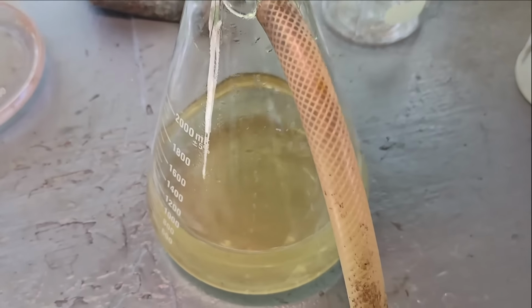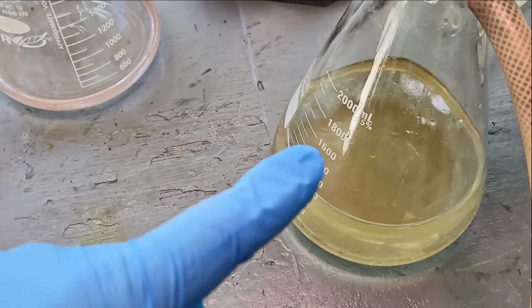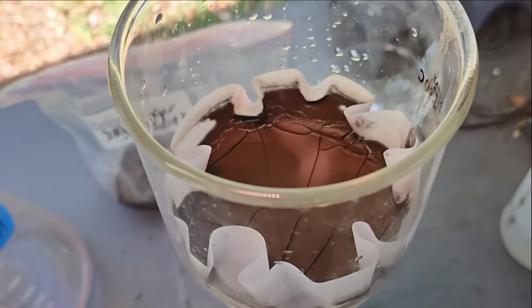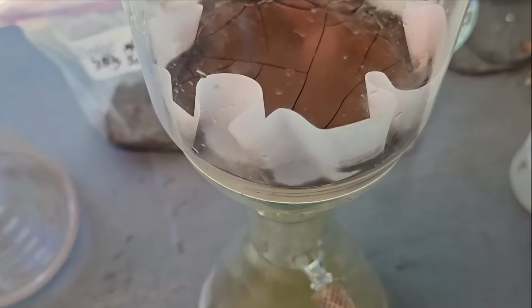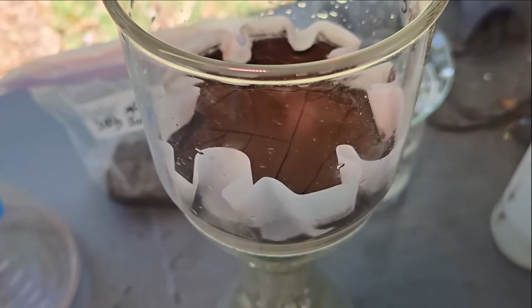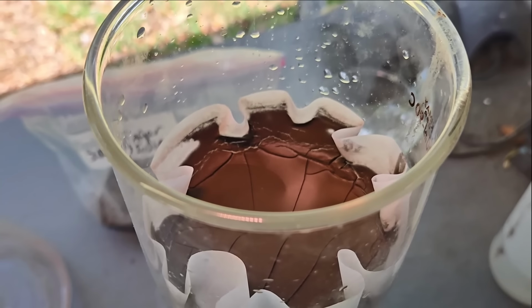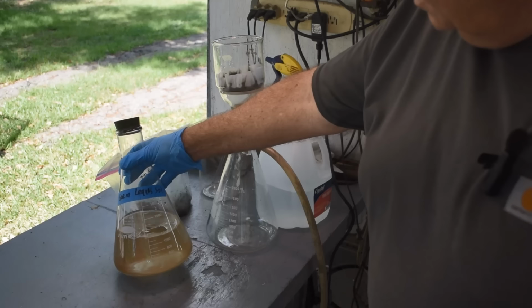But yeah, as soon as this is done and I pour this over, I'm going to start putting some distilled water through here to try and get the rest of the leach solution out of this material before we go to try and recover the gold from it. I figure I don't want to fight the leach while I'm trying to recover the gold. Alright, I have transferred the spent leach from here back into the storage bottle.